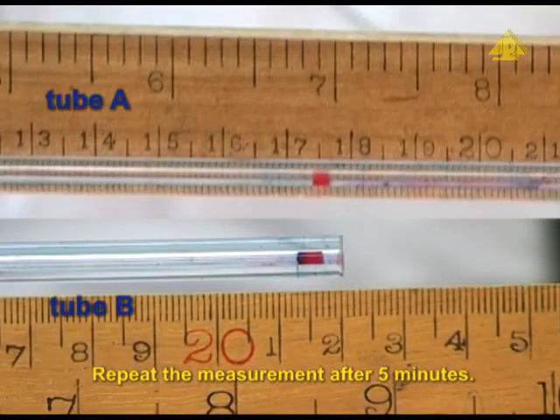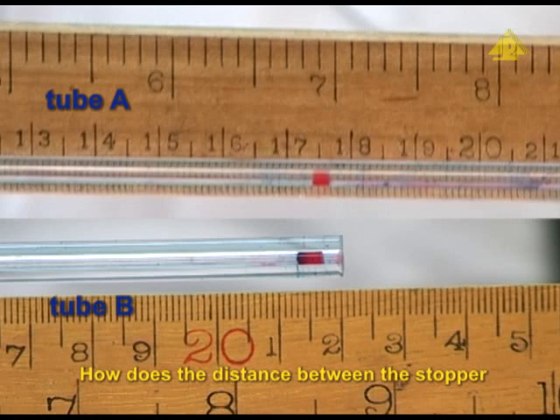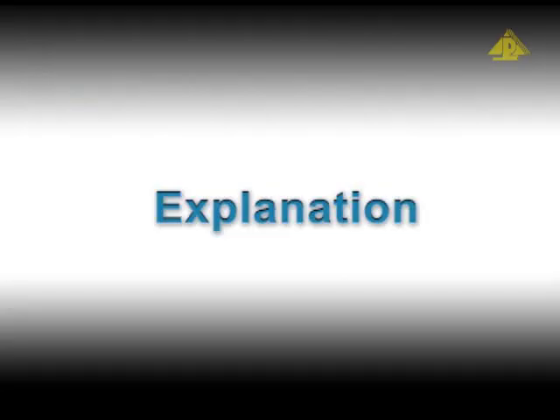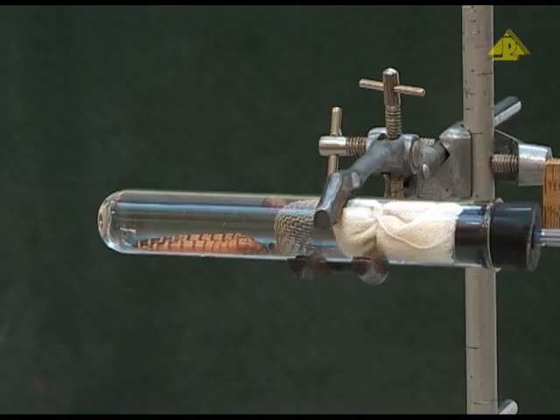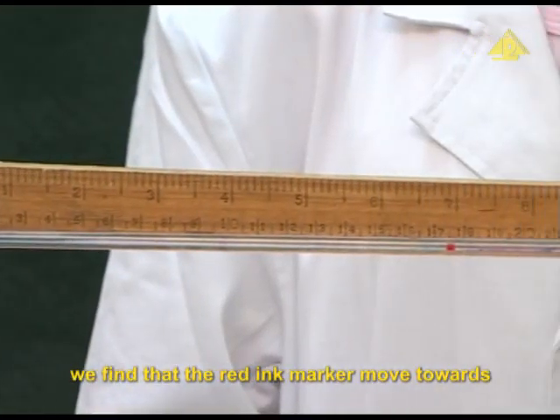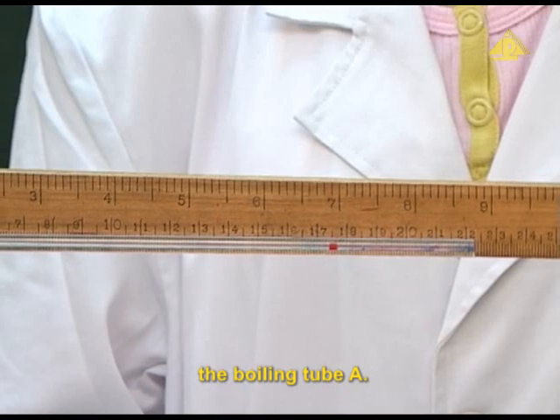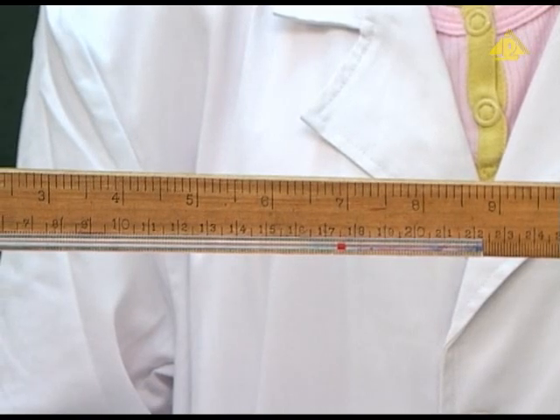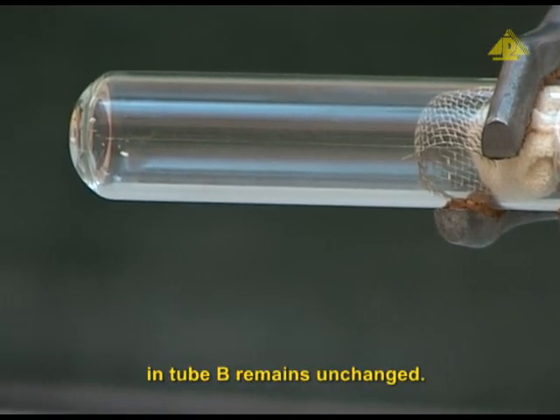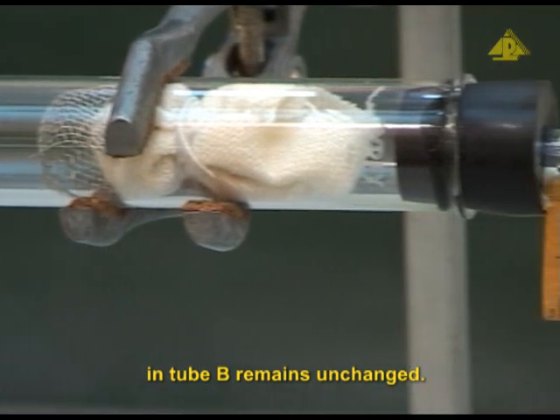Repeat the measurement after 5 minutes. How does the distance between the stopper and the red ink marker in each capillary tube change? In this experiment, we find that the red ink marker moves towards the boiling tube A. On the other hand, the position of the red ink marker in tube B remains unchanged.